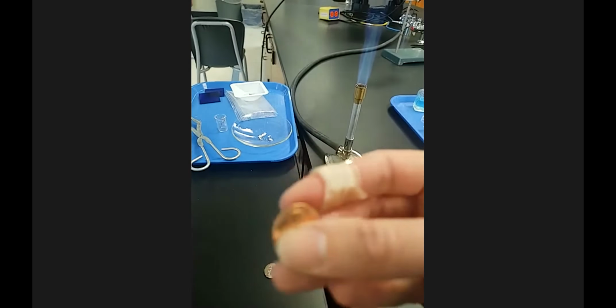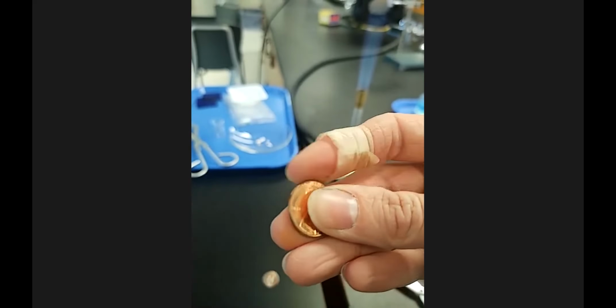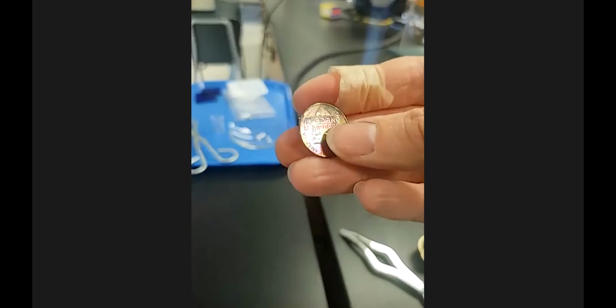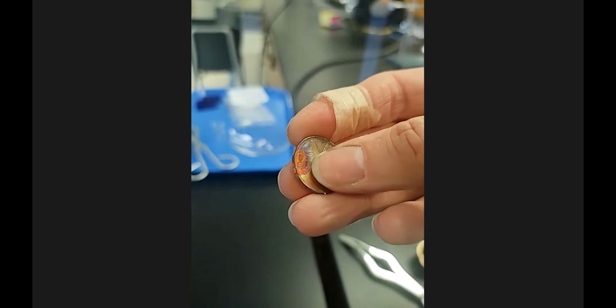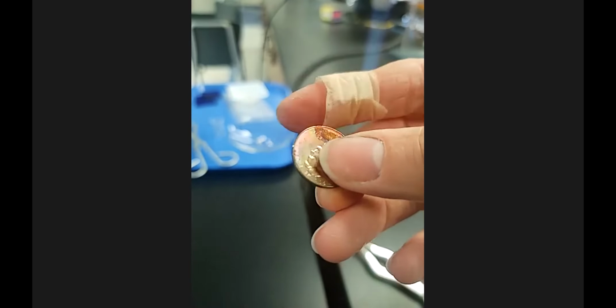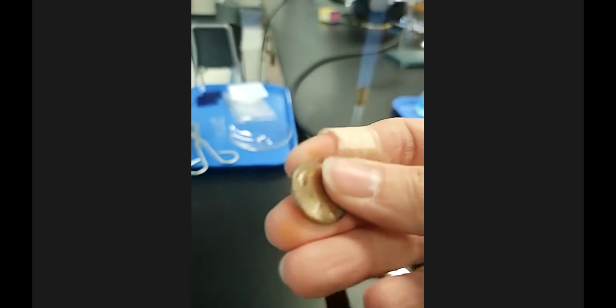So before heating, this feels smooth. Like there's definitely grooves on a penny, but it's definitely smooth to the touch. When I pick up this one, okay, besides it being warm, it's tackier. It's not as smooth. It's got a different roughness to it and a little bit of a stickiness to it. And then this is the part that I had with the tongs here, and you can see that it didn't really get heated as much because it was covered by the tongs. And so this definitely has a different texture.